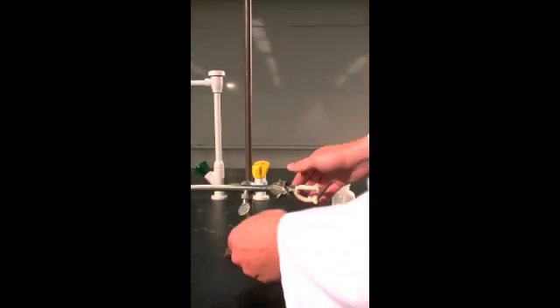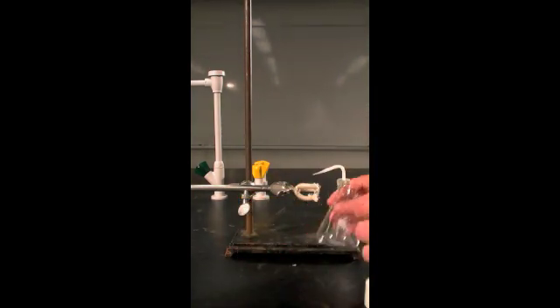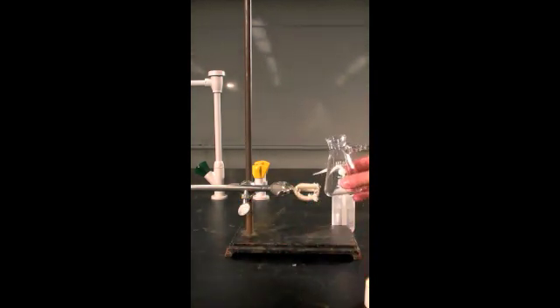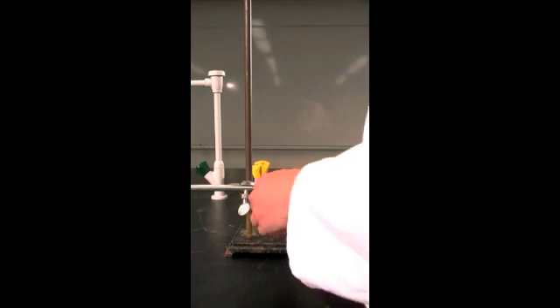This will save you some money in the long run and less broken glassware. You're just going to place your sidearm flask in the clamp.